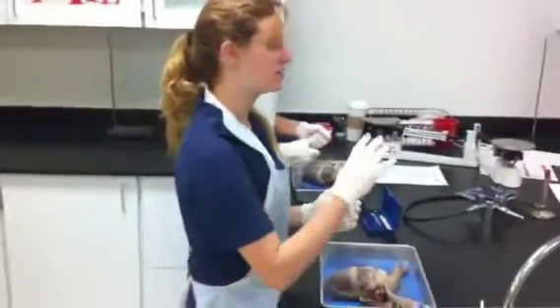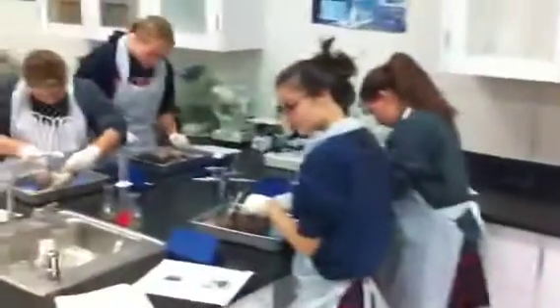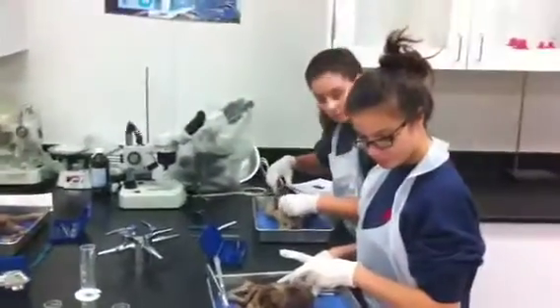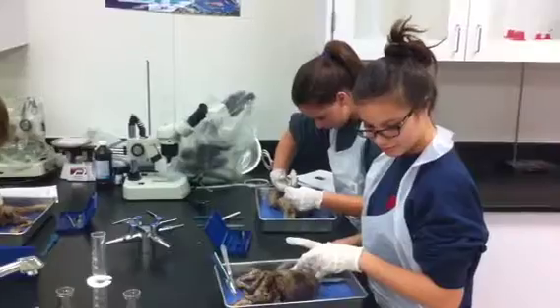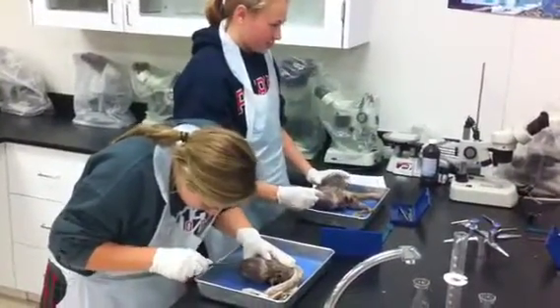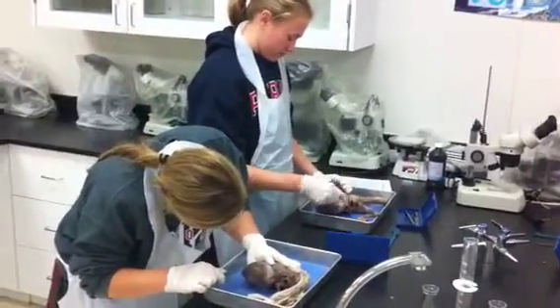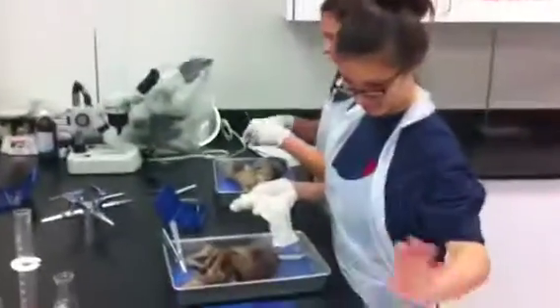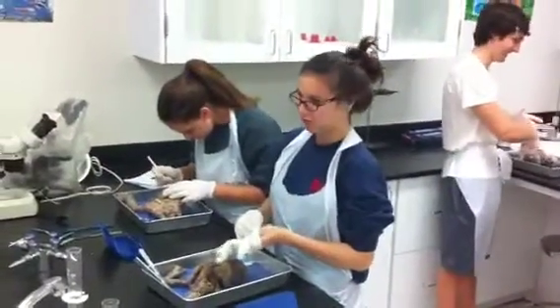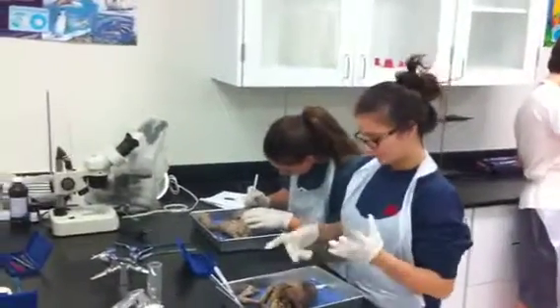You're going to see the striated cardiac muscle. You've got pericardium, myocardium, and then endocardium. I just tore the pericardium. It's a pig. Yes, it's a pig. I got heart juice all over. It's supposed to be turning white. What are we looking for? Use this thing. Don't shake your thing.